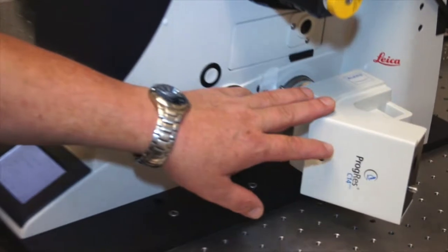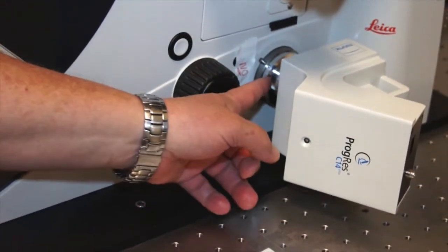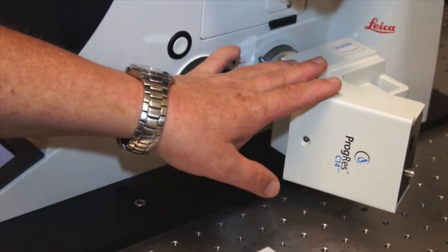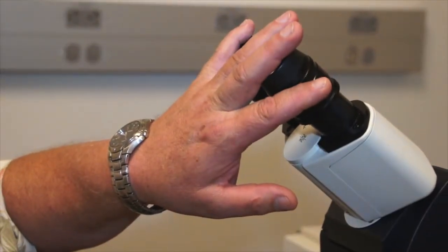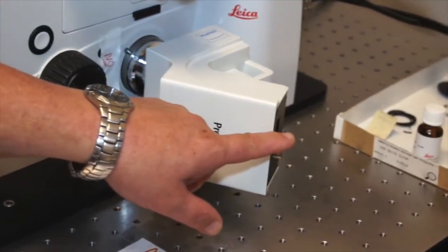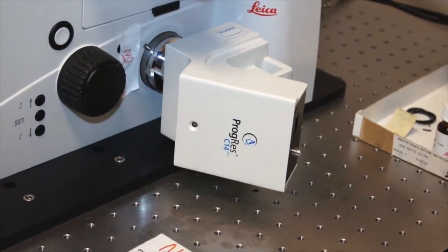As mentioned previously, we have an attachment digital camera hooked onto the camera port of the microscope, so we can take pictures right off the microscope if that's your desire. And so we can direct the beam path to go from the viewing port down to the camera port, and by connecting this to a laptop via a firewire cable, we can take pictures right off the microscope right onto a laptop.